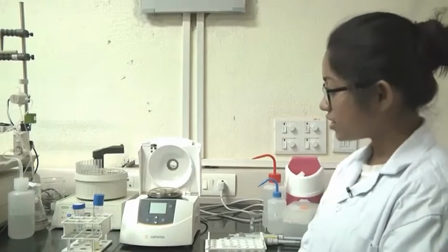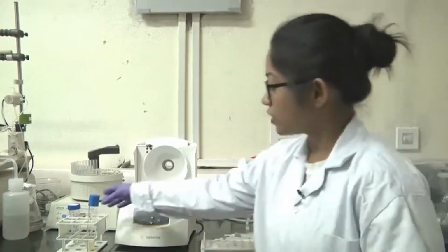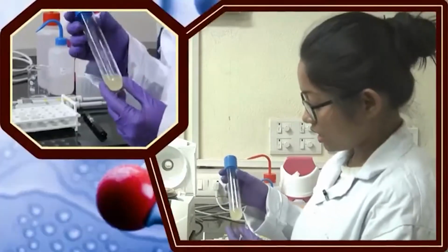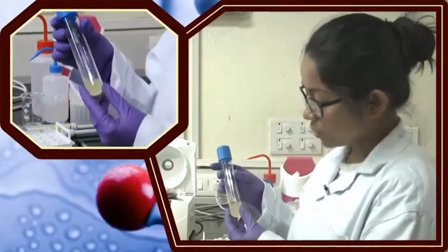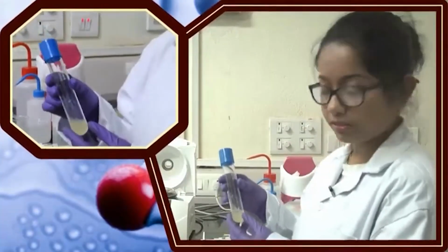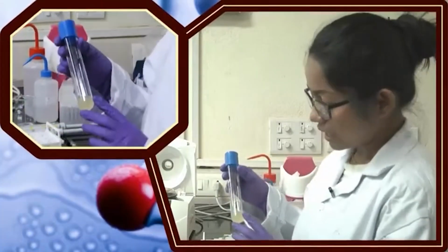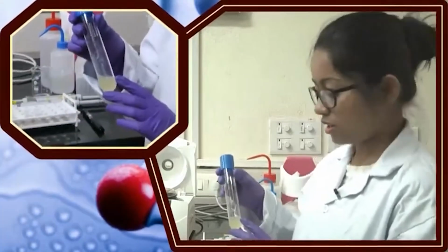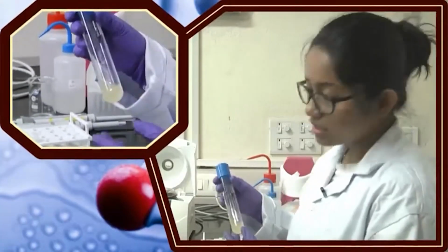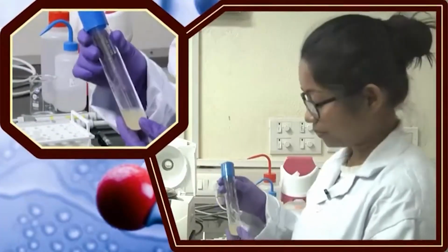So, now I have mentioned that we need an overnight culture before we go for plasmid extraction. So, here I have given this overnight culture in a culture tube, and if you can see, the culture tube is not fully filled. It is around 1/3 or less than 1/3 filled. Here it is around 7 ml of culture I have given, and I have taken LB and a small inoculum from a cell stock which is kept at -80°C. Otherwise, if you have a colony, you can pick one colony and put it inside the culture tube.